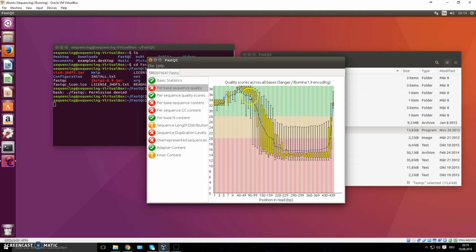It is normal to get a drop at the very end, because most sequences lose quality at the very end. That's fine. It's not too bad. But in this case, this file does not look good.